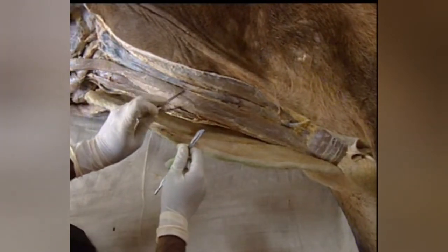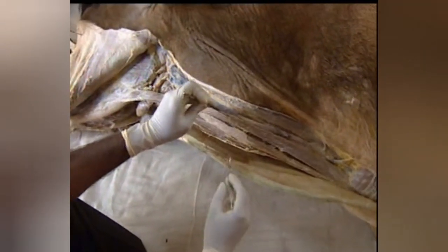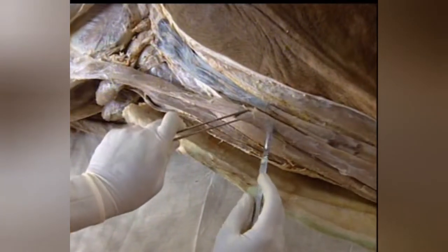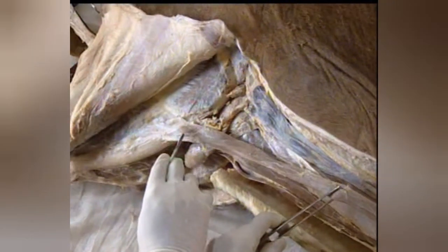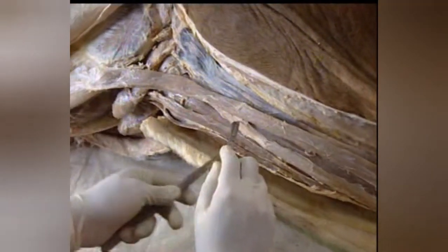This long muscle is the sternocephalicus, which extends from the manubrium sterni to the skull. It consists of a superficial part called sternomandibularis and a deep part known as sternomastoideus. Both these parts originate from the manubrium sterni. The sternomandibularis passes upward and forward to be inserted to the masseter and lateral face of the angle of the jaw. The sternomastoideus is mostly overlapped by the superficial division and passes upward and forward to be inserted to the mastoid process, wings of the atlas, and basilar tubercles.